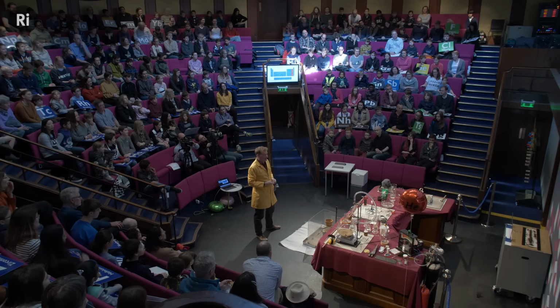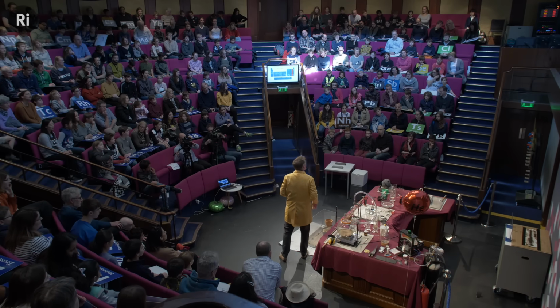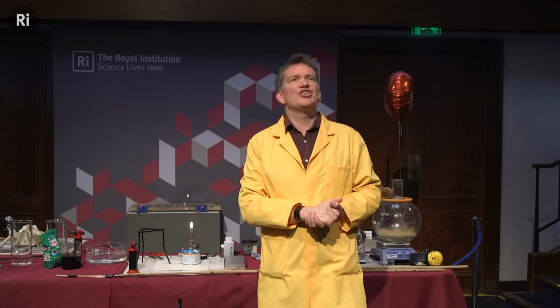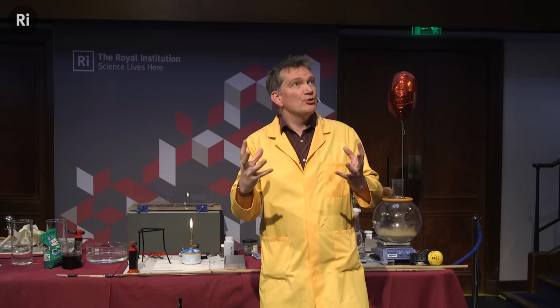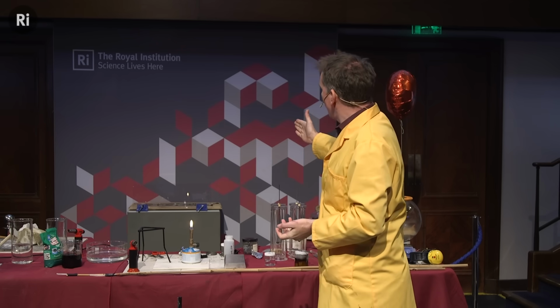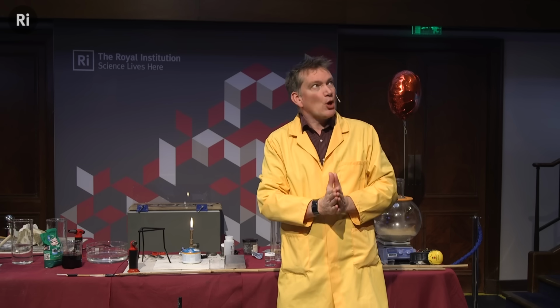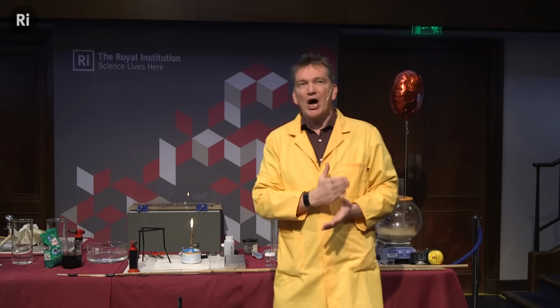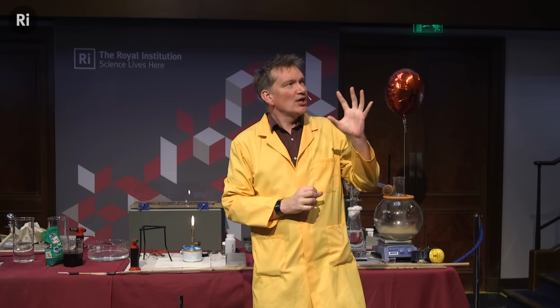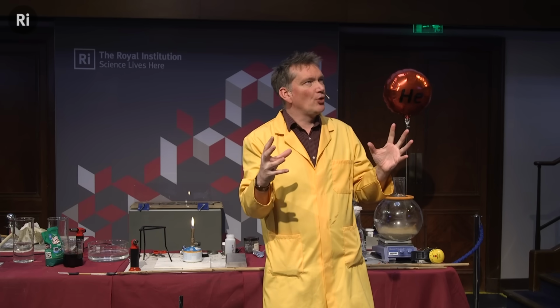I thought I might show you one of these elements now, despite the fact that some of them are very, very toxic. I'm going to show you some iodine. And remember, this gets its name from this beautiful violet color. So we're going to make some iodine. Now, at the back of the lecture, and this is why you had to come in through the sides, I've put a very explosive compound. This is called nitrogen triiodide. And this compound has nitrogen bonded to iodine. But these are very, very weak bonds.